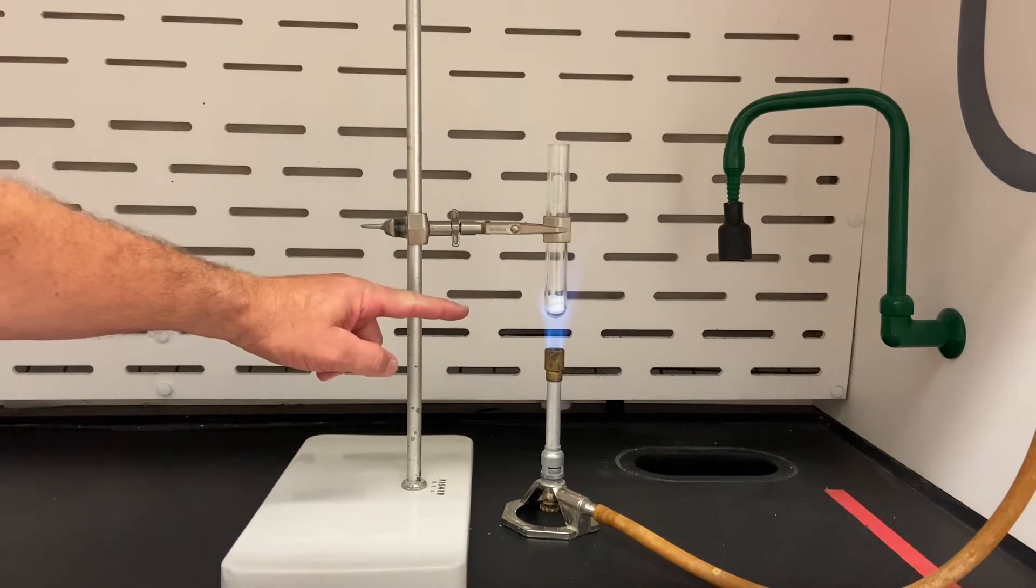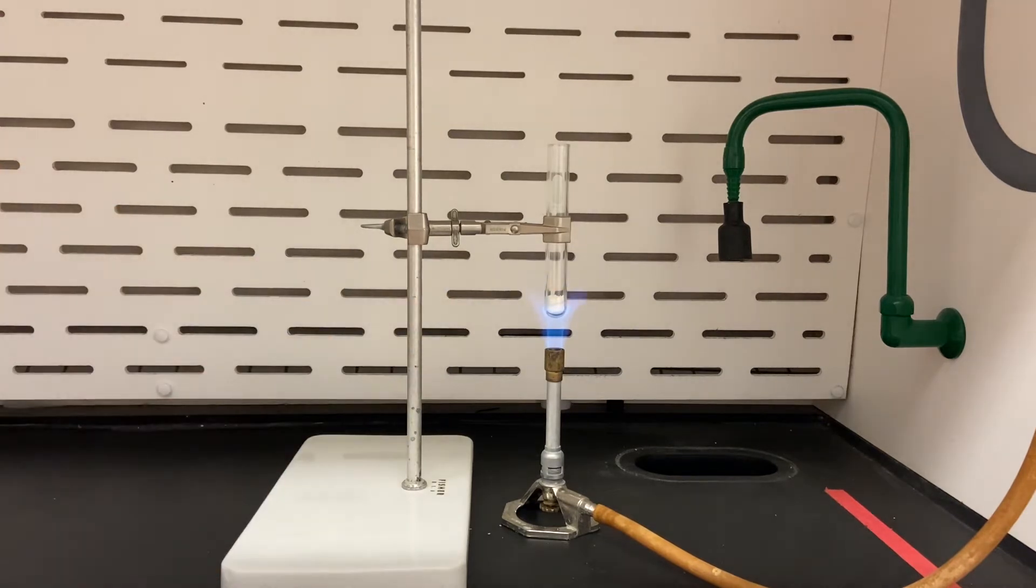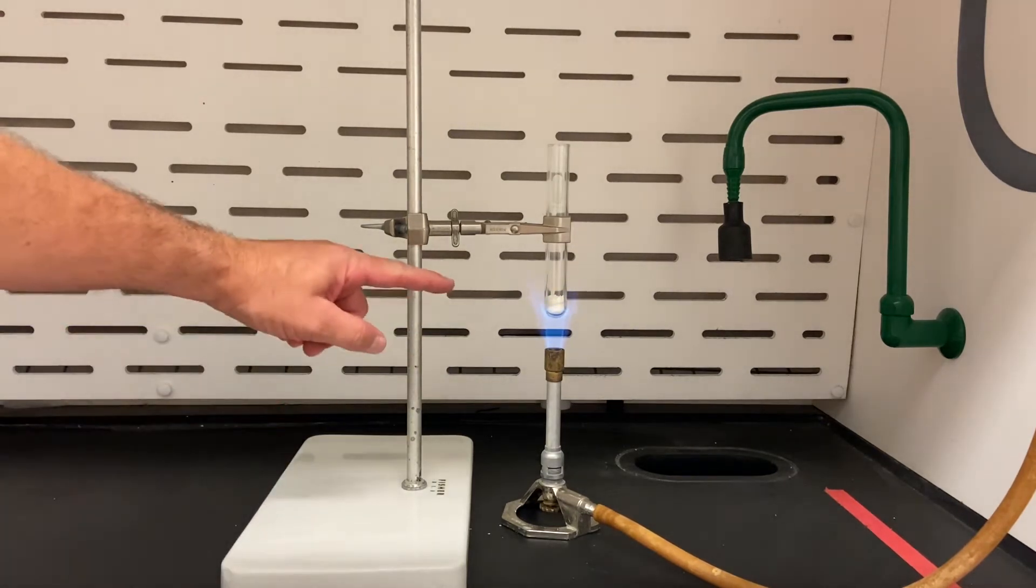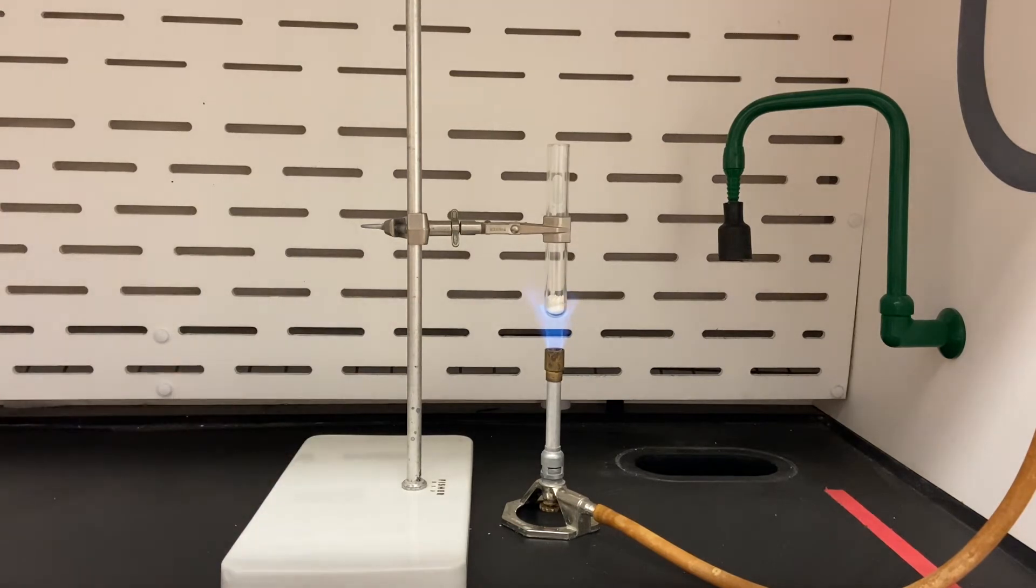Okay, so now if you look you can start to see some potassium chlorate liquid forming. So we're going to let that go for just a couple of seconds longer here. And then we're going to add our skittle to that mixture.